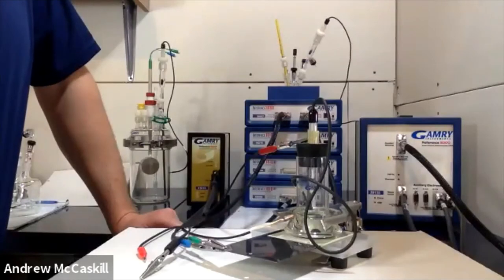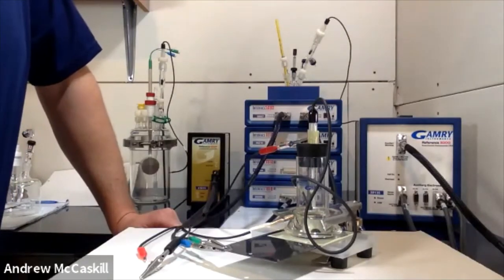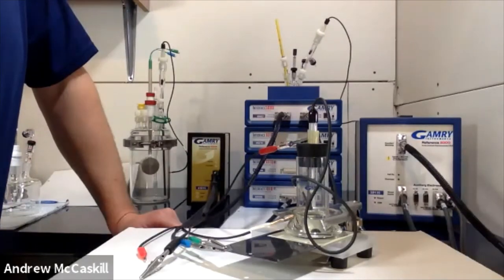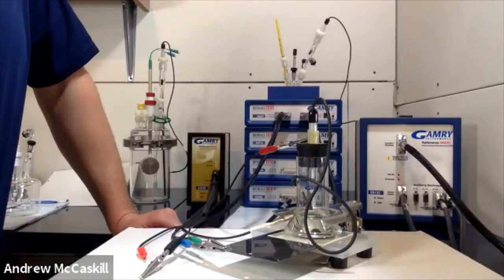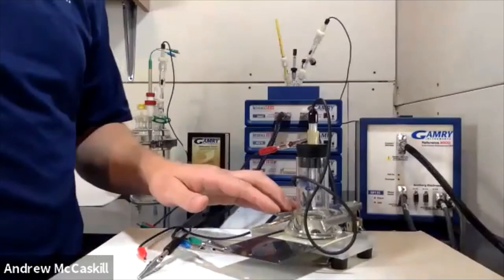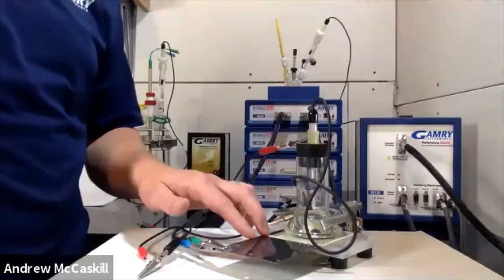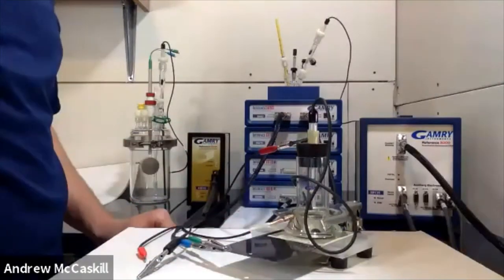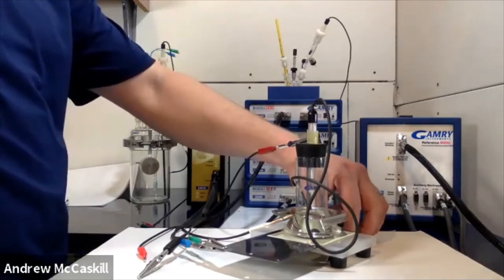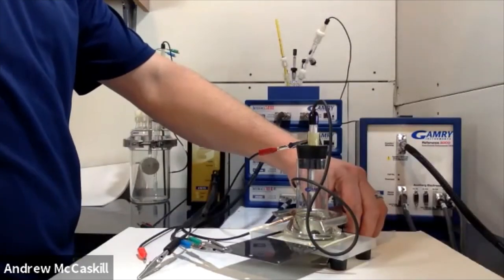For a more corrosive bare steel surface that will corrode relatively quickly, this cell works very well for a single experiment such as linear polarization resistance, a potentiodynamic scan, or EIS impedance spectroscopy. If you're doing very long-term exposure experiments on something corrosive that will create a lot of corrosion products — changing the concentration and composition of the electrolyte — then this probably isn't the right cell for that. But for a coated sample you can run long-term experiments; for something highly corrosive it's still good for short-term work. It's also a relatively inexpensive cell, so if you need to run many cells simultaneously it will keep your costs down.